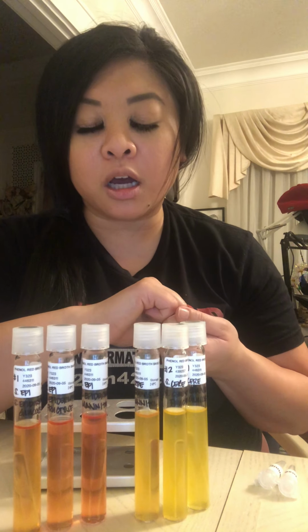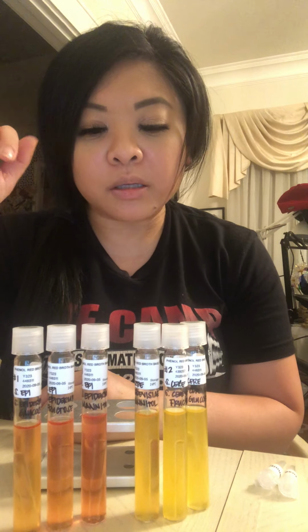And I also had quite a bit of anxiety doing this experiment, making sure I transferred half of the powders properly, making sure that I was doing my aseptic technique, making sure that there was no bubbles in the Durham tubes, as well as having the Durham tubes dry, because it did take quite a while for it to dry from being inside the alcohol. And also I did find it interesting that everything changed in just a span of hours, and it was very quick. So that concludes my video for carbohydrate fermentation.